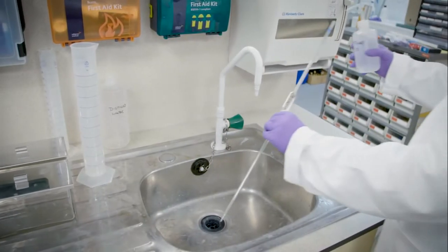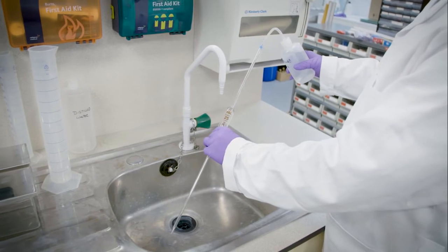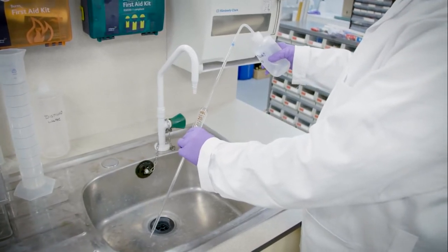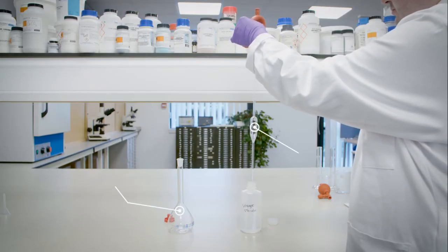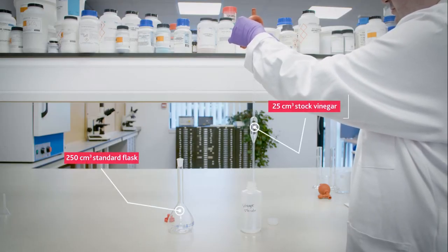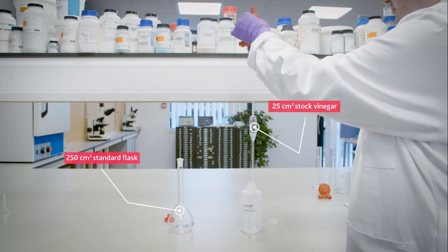First, a dilute vinegar sample needs to be prepared. A 25 centimetres cubed pipette is cleaned by rinsing with deionized water from the wash bottle. The vinegar is diluted by pipetting the stock vinegar solution into a standard flask.